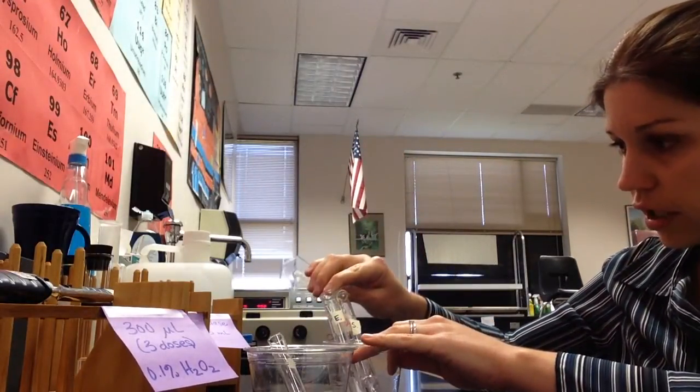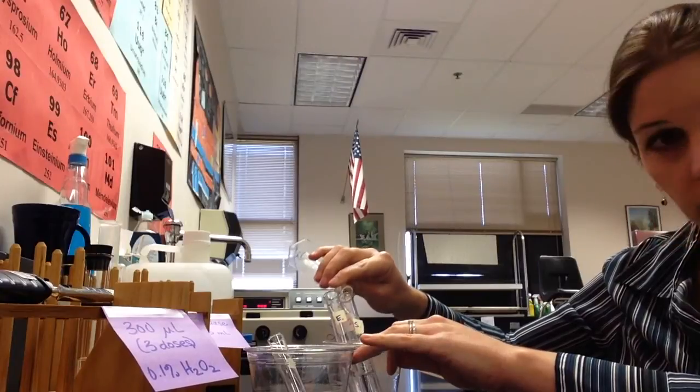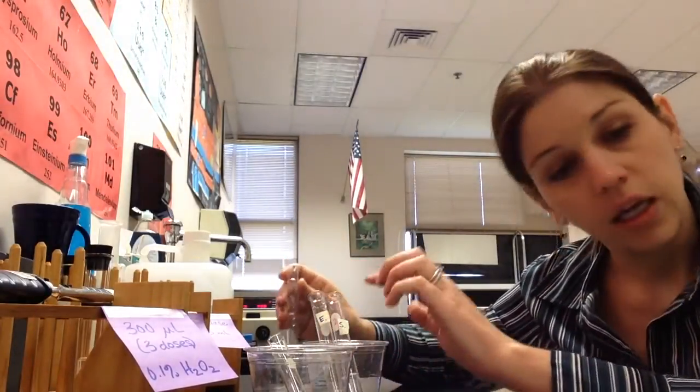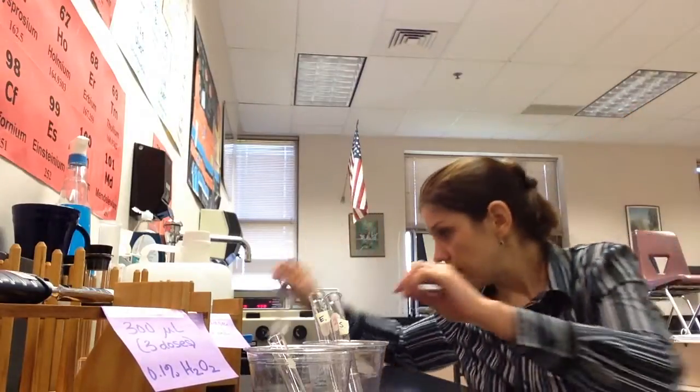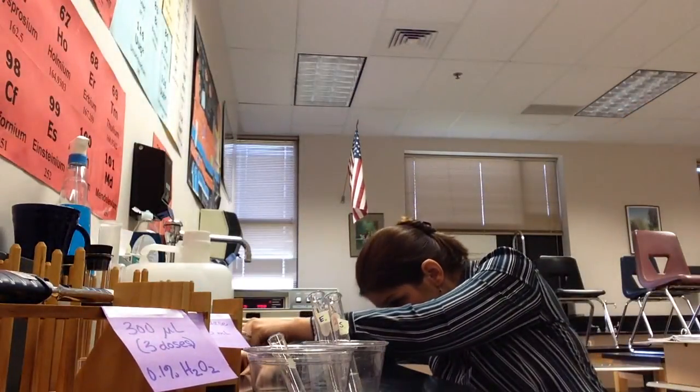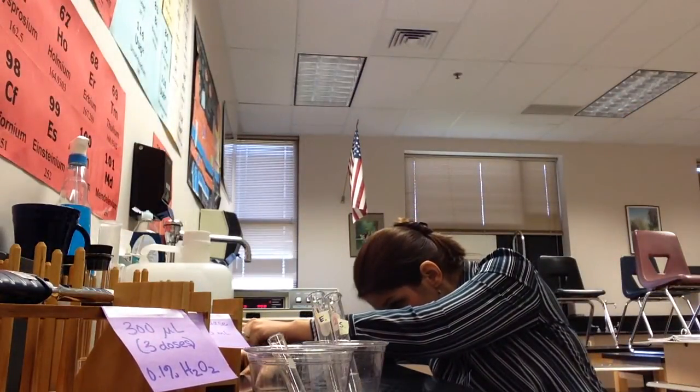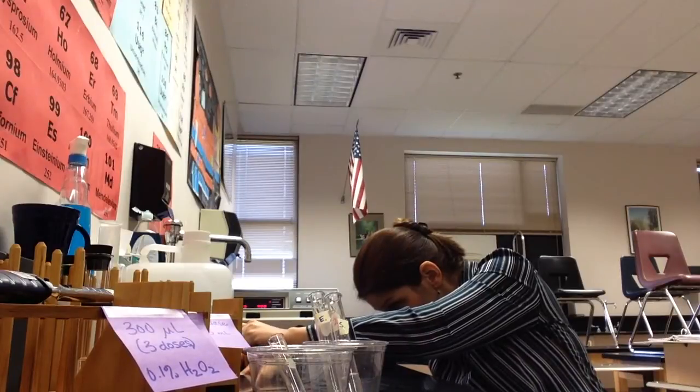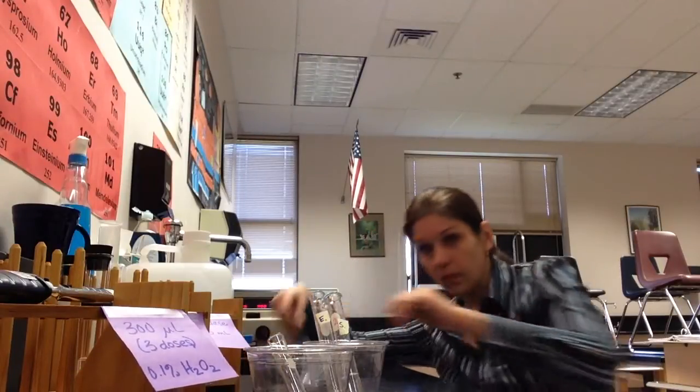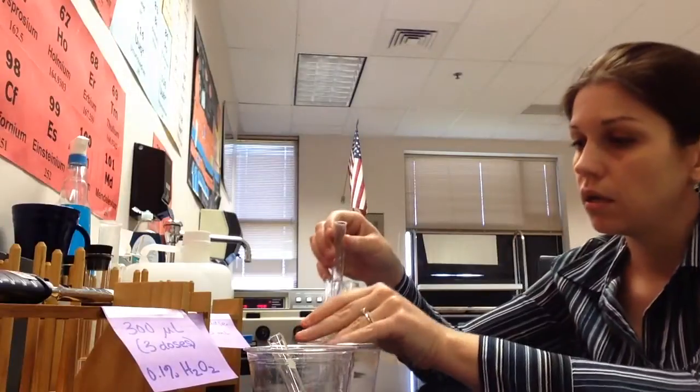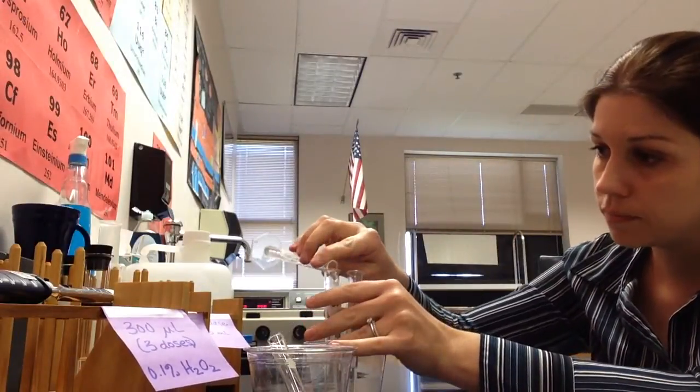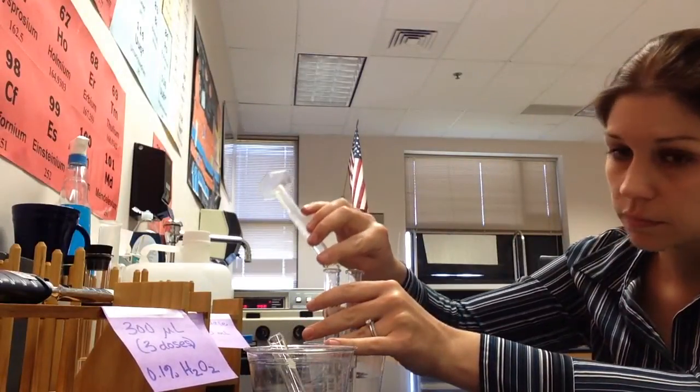You guys are going to actually have test tube racks, not cups, because I don't want these to fall over. And then I'm going to get six mils for my enzyme tube. Okay. And enzyme. And we're good to go there.